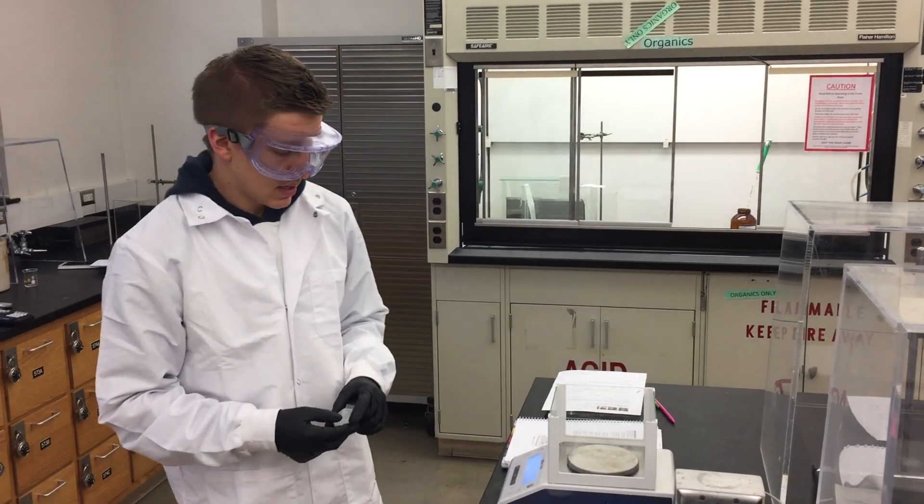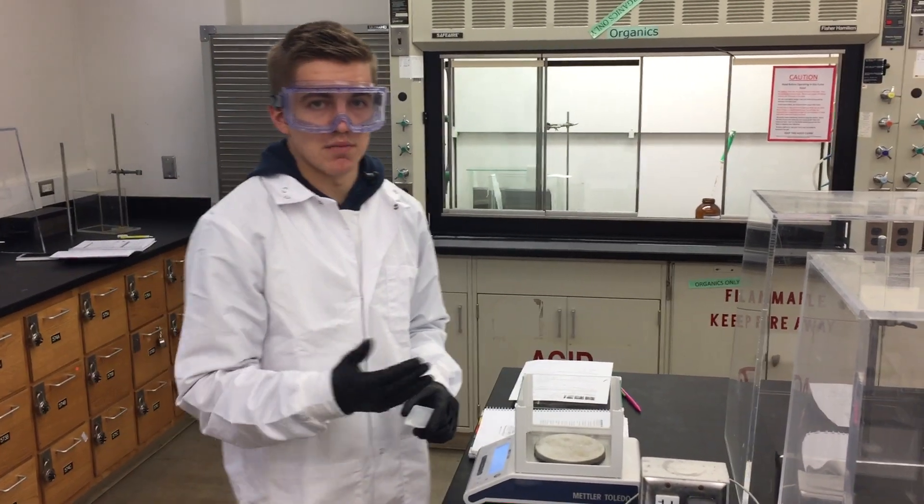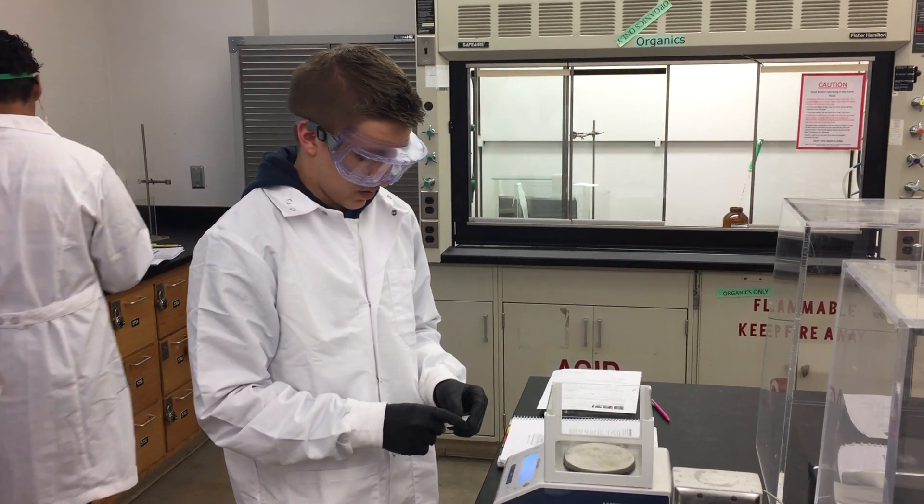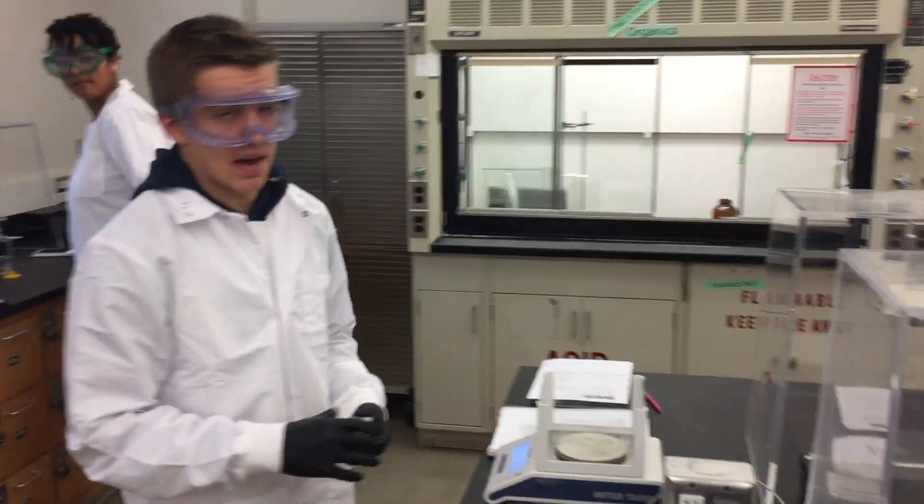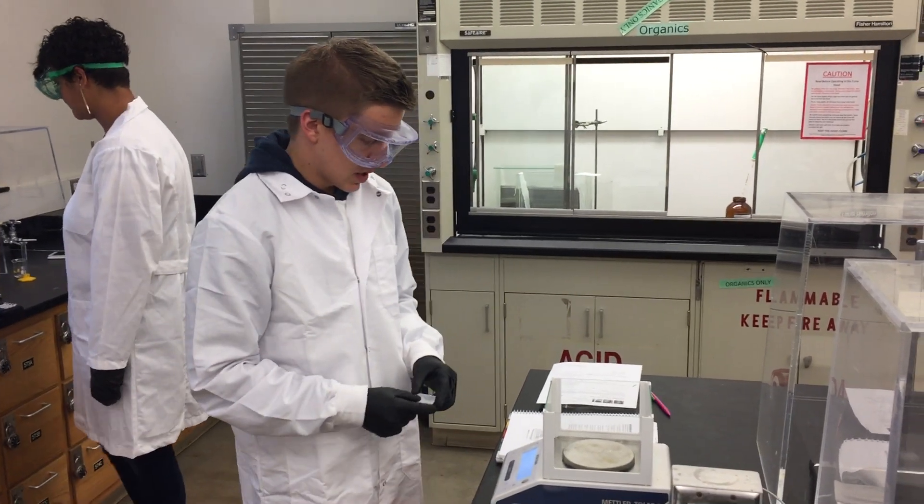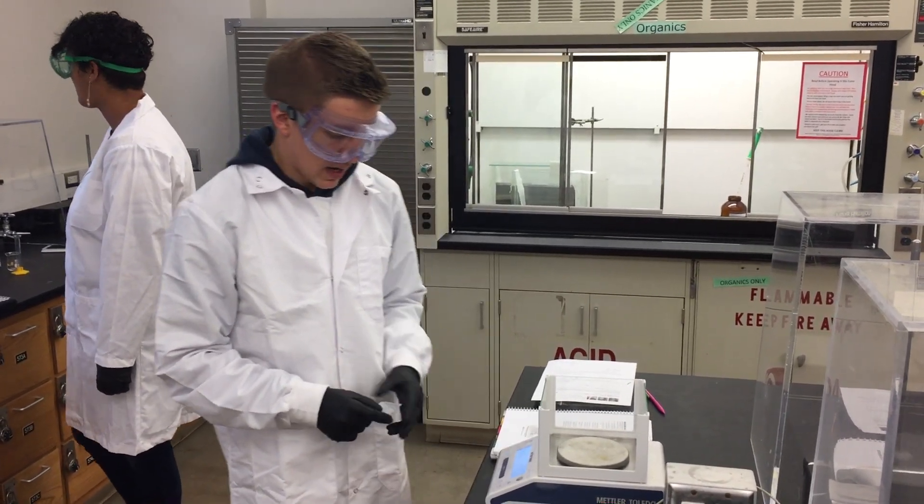Today we're working on measuring mass. Occasionally we have to make solutions with solids mixed with water, and you have to have the appropriate mass measured out. To do that, we use the scale, and we're going to start.